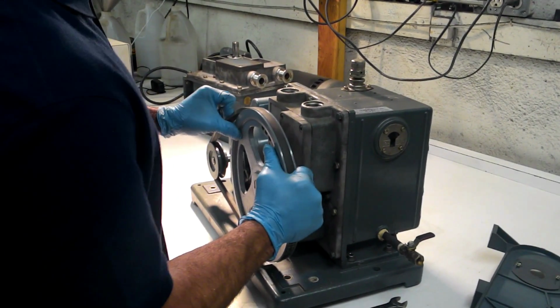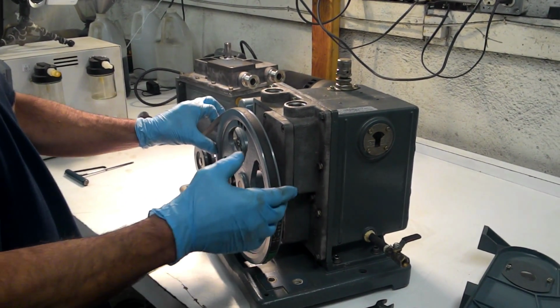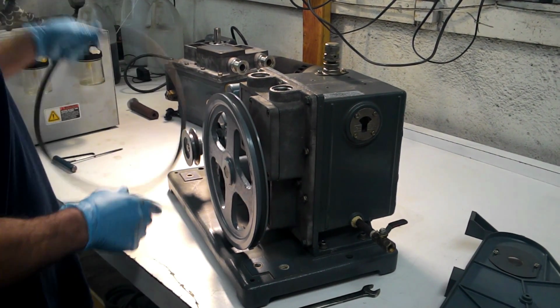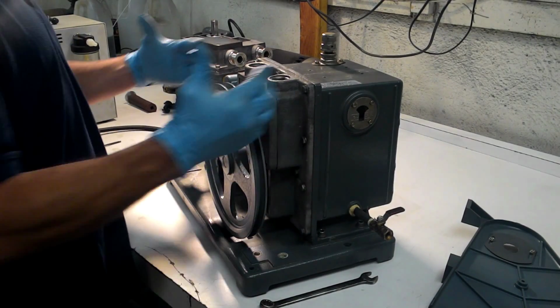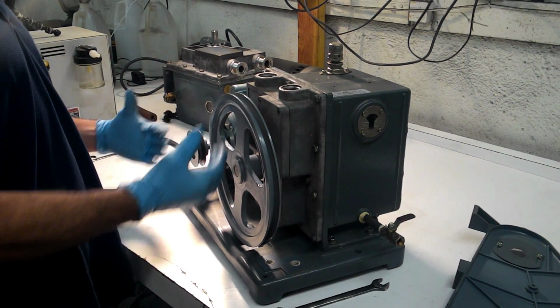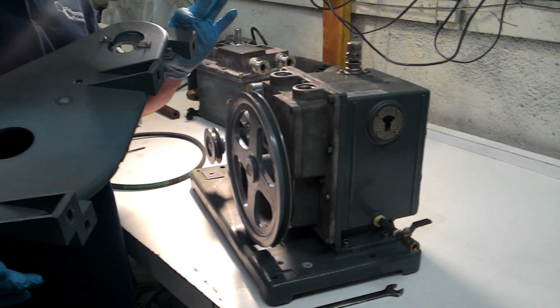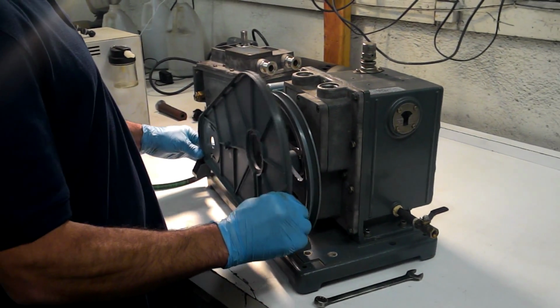So basically the belt comes off very simple. You just pull it towards you, turn the pulley, it comes right off. Normally when you do a belt alignment or changing a belt on one of these pumps, you're going to have this piece here, which is the back part of the belt guard. This goes behind all of this.